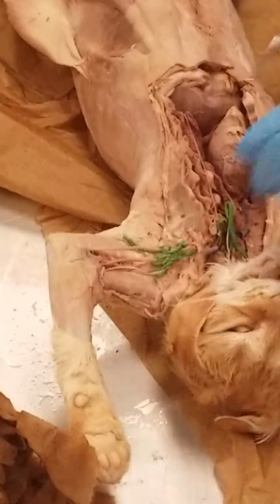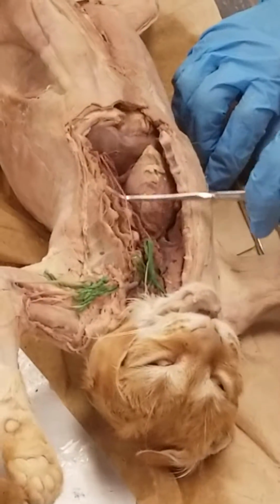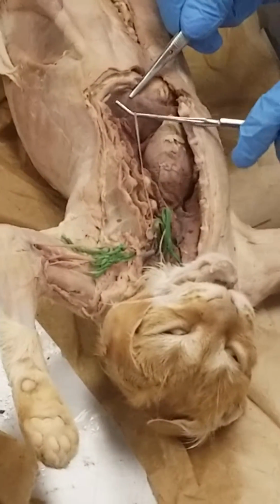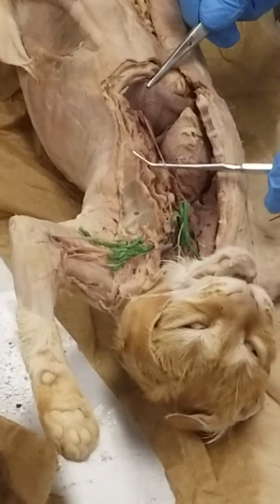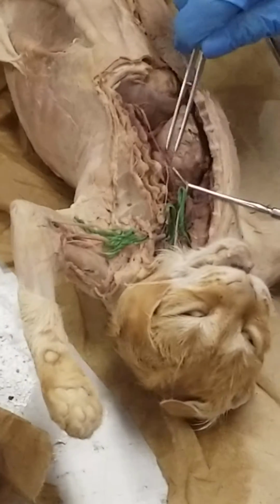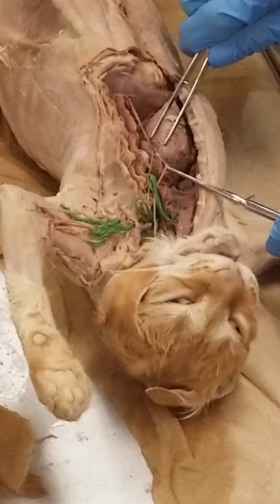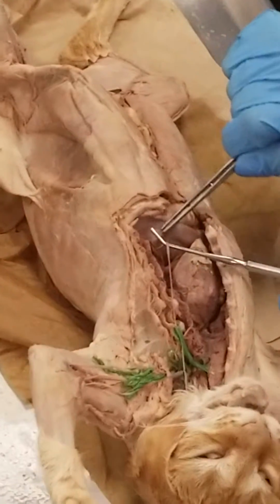There are 2 of them that run down the thoracic cavity that we need to know. This long one here is going to the diaphragm muscle, which is our chief muscle in breathing. So this nerve that innervates the diaphragm is the phrenic nerve here. And then this nerve that's going to the heart, this is the vagus nerve. So vagus nerve, cranial nerve 10, is going to innervate the heart. Phrenic nerve innervates the diaphragm muscle.